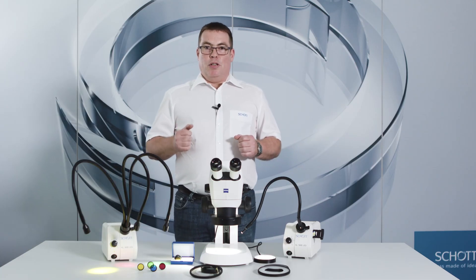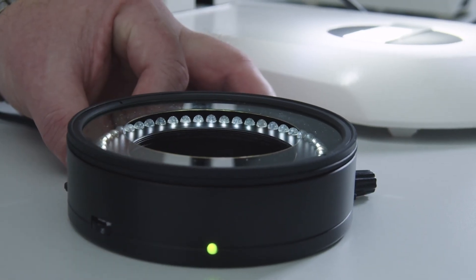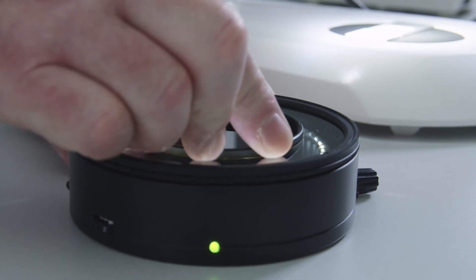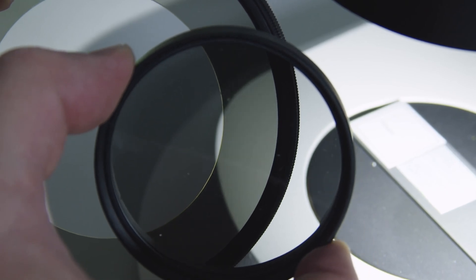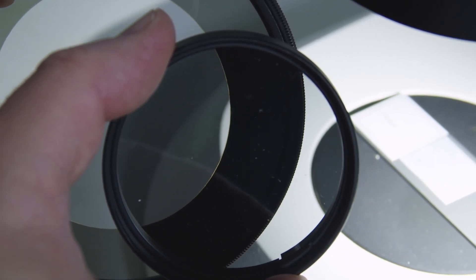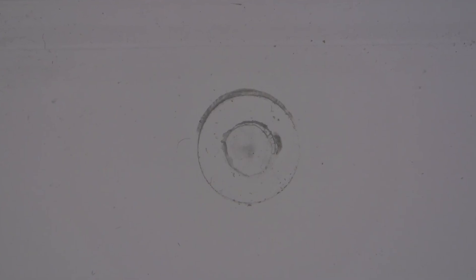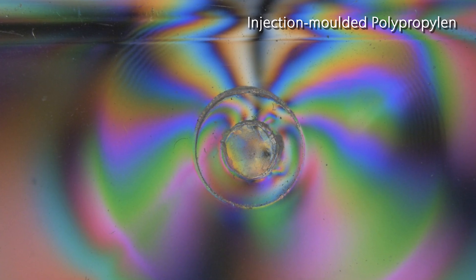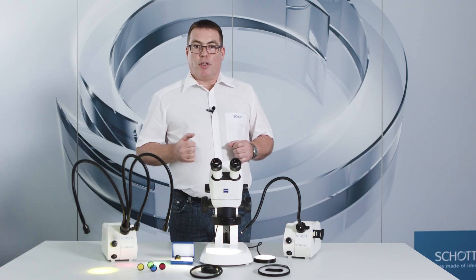Finally, I would like to introduce you to the polarization sets. For polarization, you always need two parts: the polarizer and the analyzer, which are typically oriented at 90 degrees to each other. As with a diffuser, this also reduces surface reflections, but can also be used to create highlights or make hidden features in the material visible. These can occur in injection molded plastics, for example.